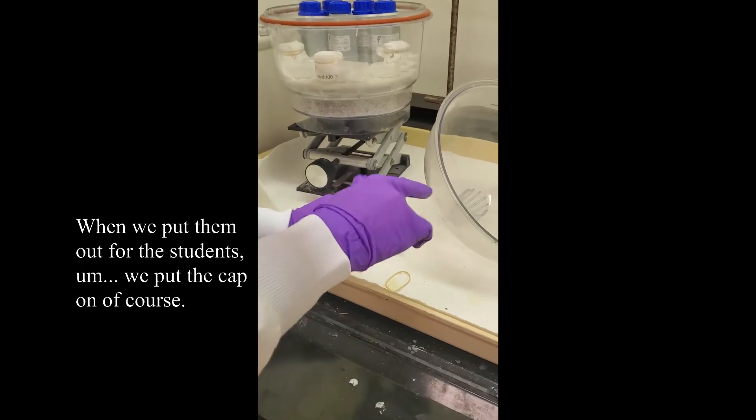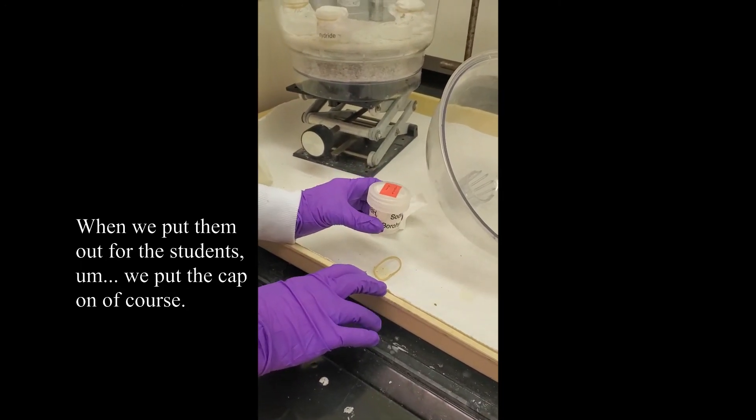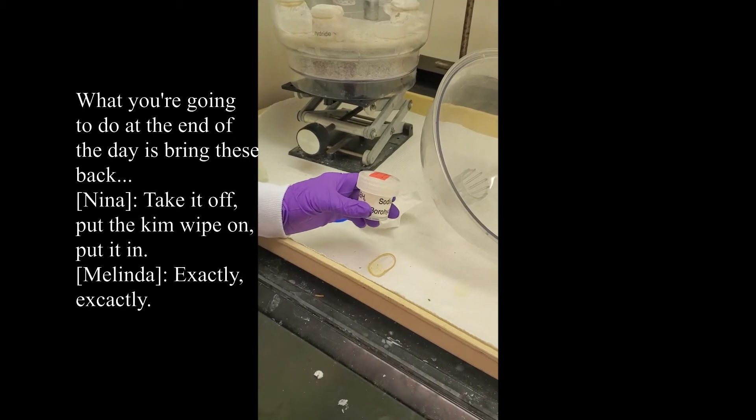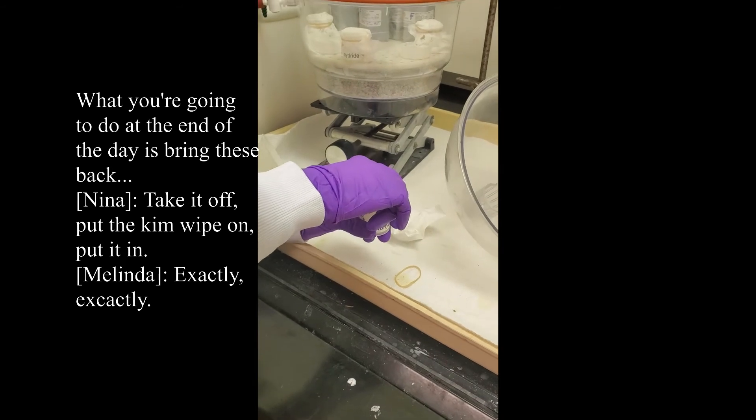When we put them out for the students, we put the cap on, of course. What you're going to do at the end of the day is bring these back, take it off, put the Kim Wipe on, put it in.